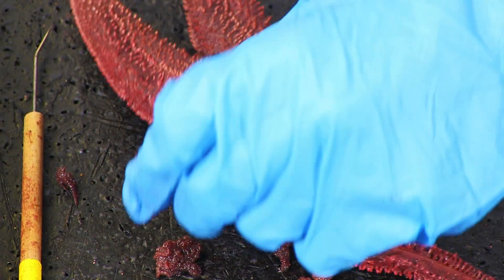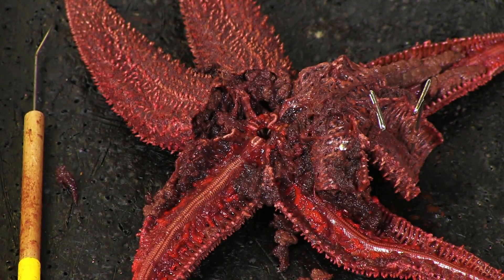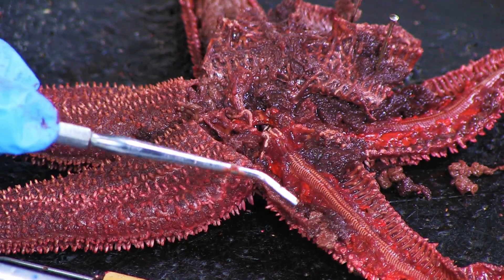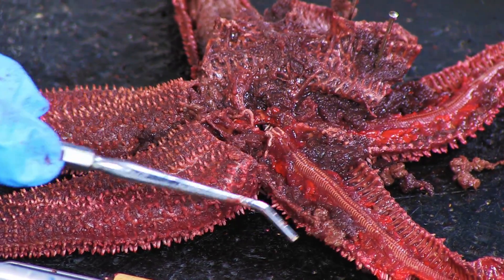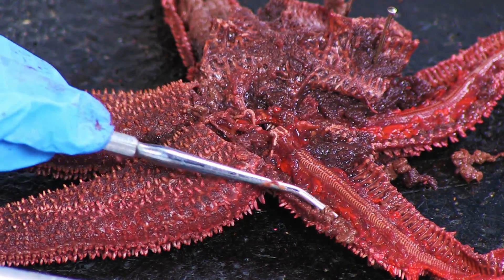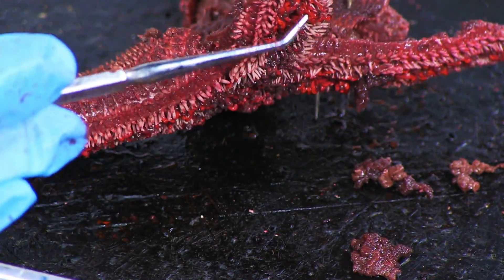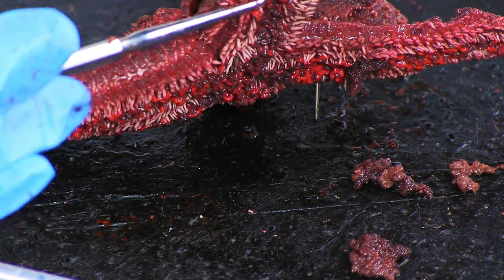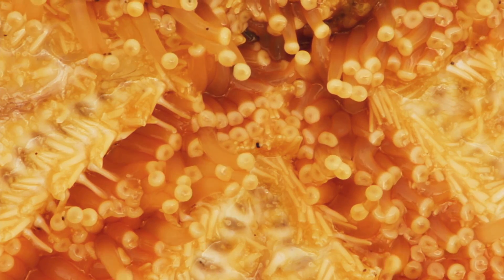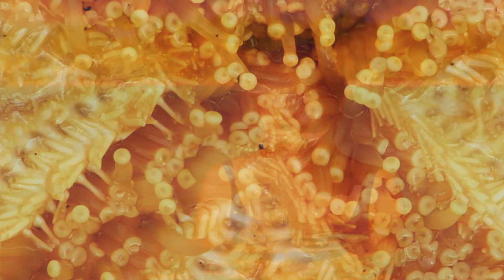This system of ducts is referred to as the water vascular system and allows for the starfish to move. Water from the radial canal fills the ampulae. When the ampulae are squeezed, they push water into the tube feet which are directly connected to the ampulae. The water vascular system expands or contracts the tube feet and acts as a hydrostatic skeleton.